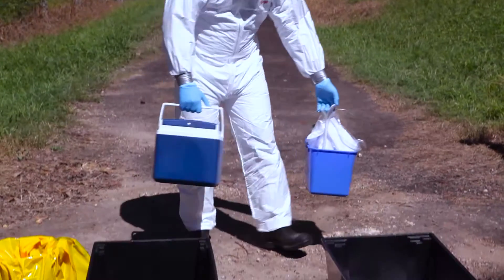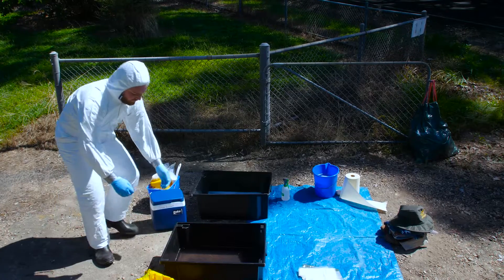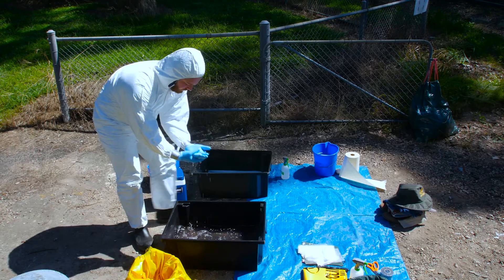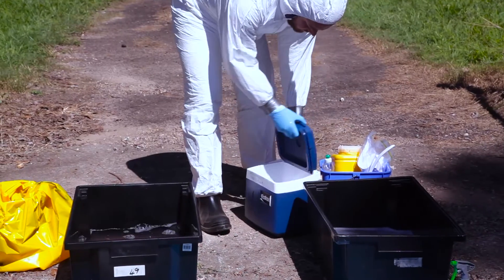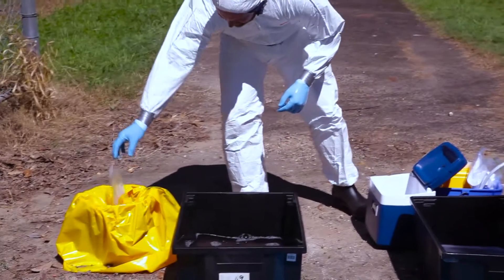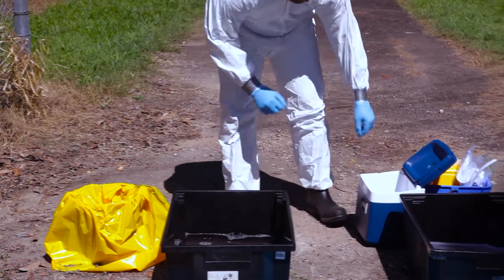Approach the personal decontamination site, then rinse gloves in the disinfectant tub as a precautionary measure before handling samples. Place disposable sampling equipment from the esky in the biohazard bag previously placed on the dirty side during the setup procedure.